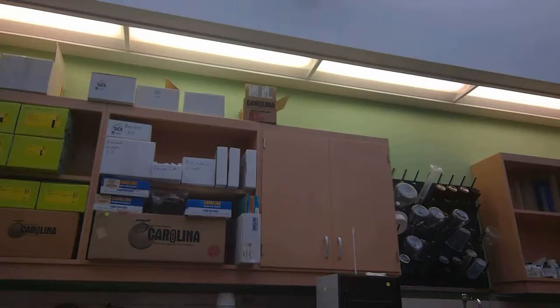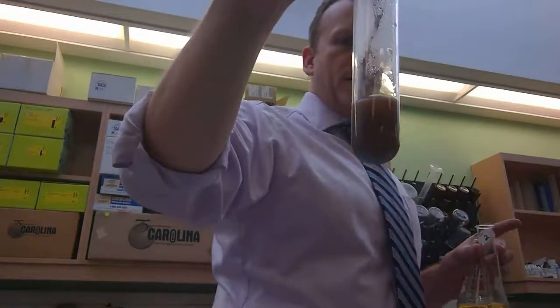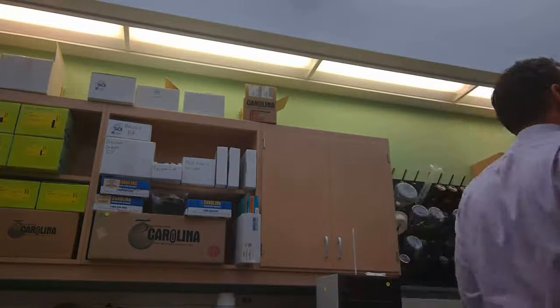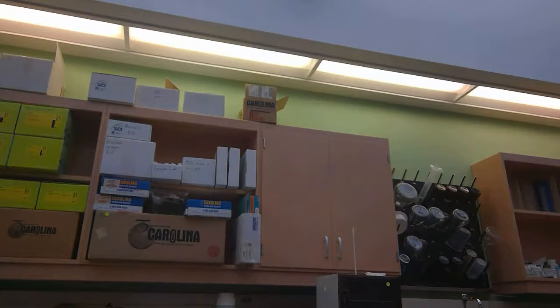We set this in here as blue. What is it now? Brown. It's a brownish red, right? So is that a positive or negative result for monosaccharides? Positive. Yeah, it's a positive result, a positive change. So your experiments have told you the following with respect to glucose. Yes, it's a monosaccharide. No, it's not a polysaccharide. So your conclusion should be that glucose is what type of carbohydrate? A monosaccharide.